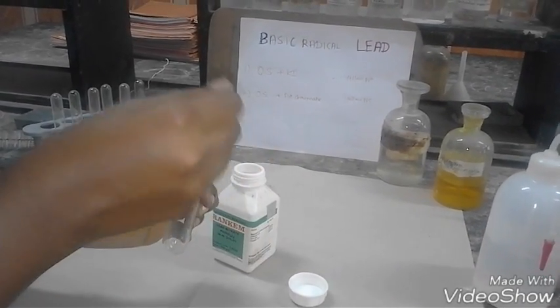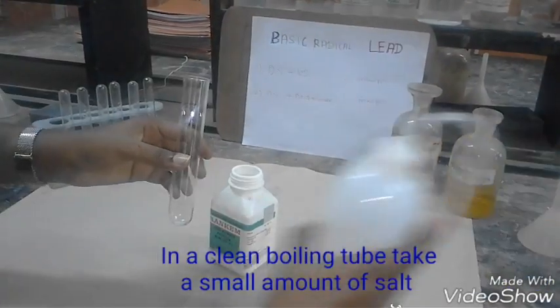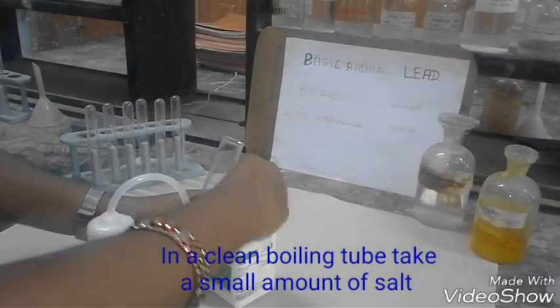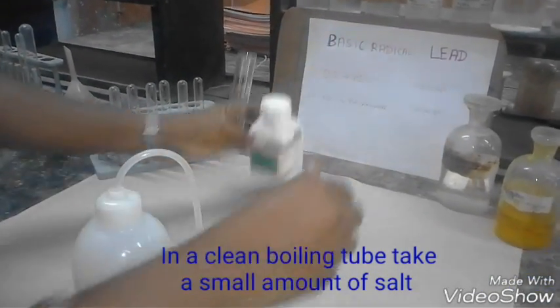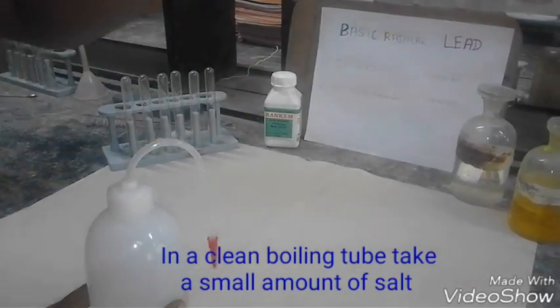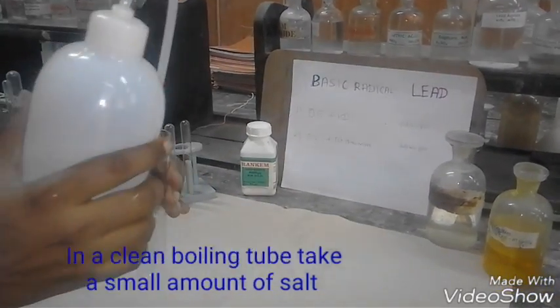Take the boiling tube. I am now going to prepare the original solution. So take a little amount of salt and dissolve the salt in distilled water.